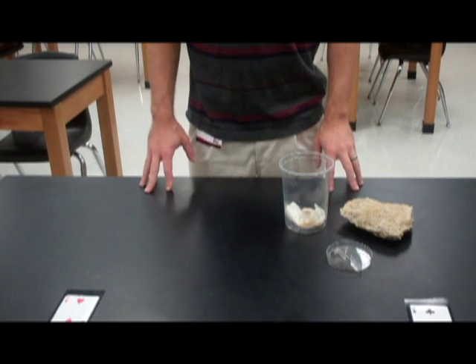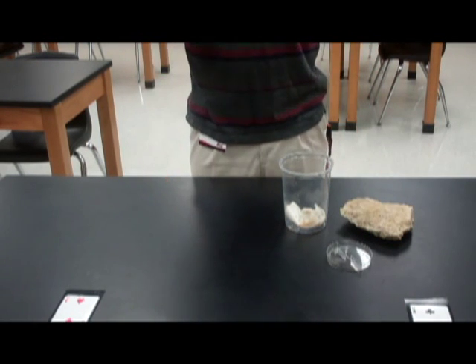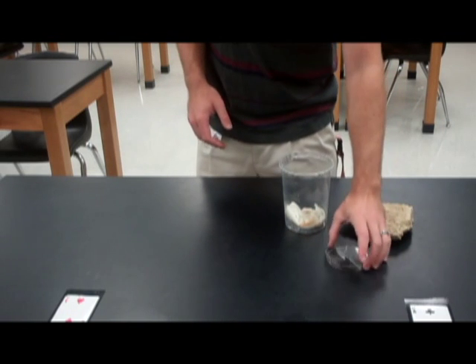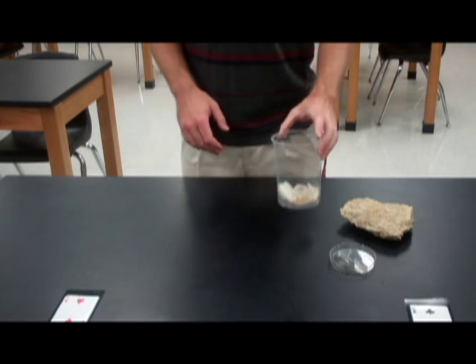Hi there, I'm Michael Ralph. Today we're going to be doing the pill bug lab. You're going to need everything you see right here, including a choice chamber and some pill bugs.